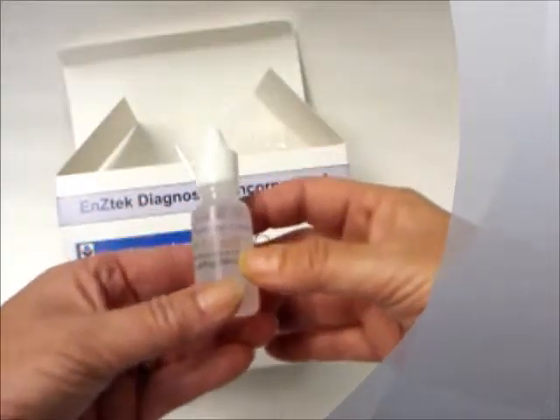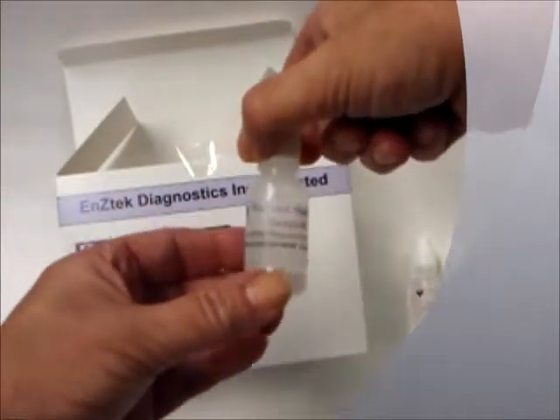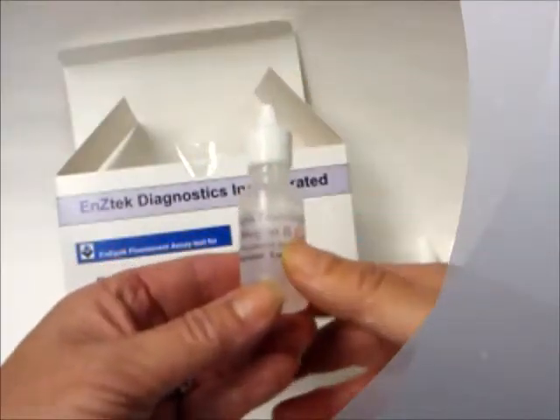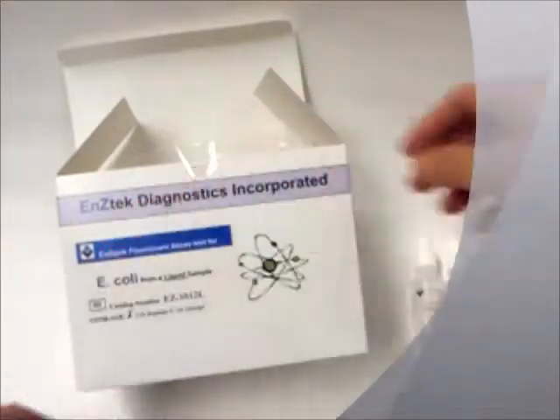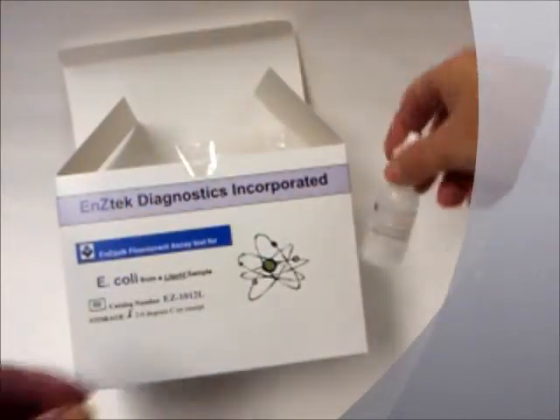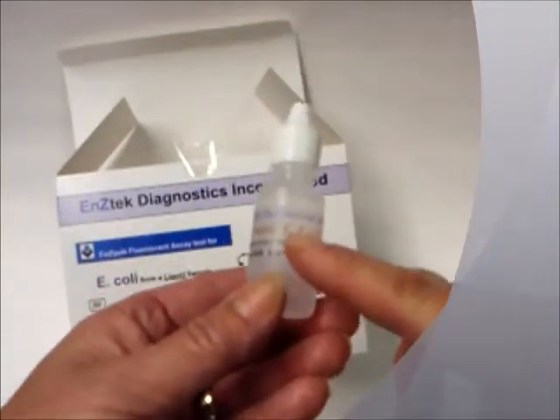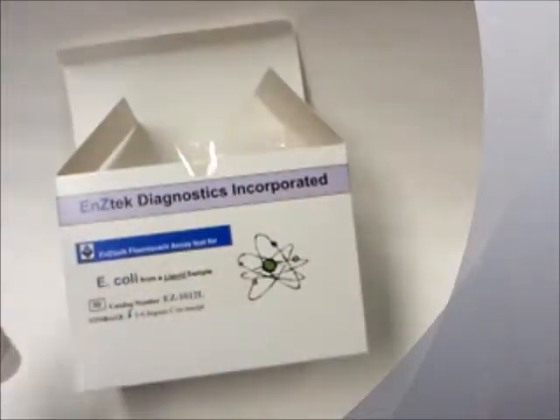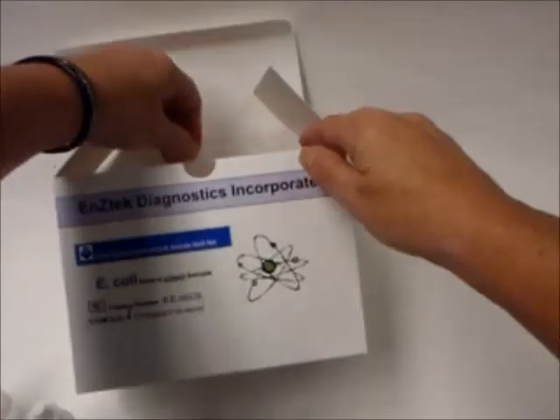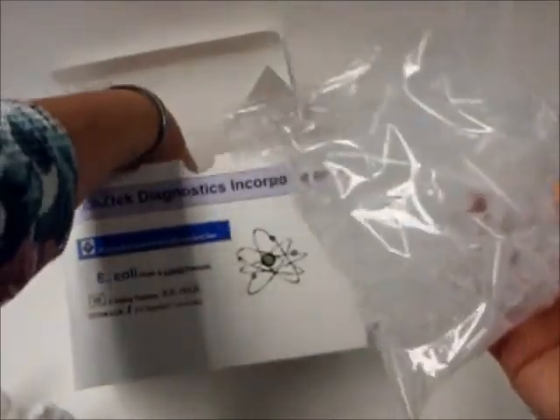There is a bottle of Reagent B, which is an enzyme inducer and helps trick the bacterial cell into producing more enzymes. Not all kits contain Reagent B. There is one bottle of Reagent C, which is a lysing agent. Some bacteria have enzymes which are intracellular; therefore, a lysing agent is used to rupture the bacterial wall and release the enzyme. The kit also contains plastic mixing vials and small glass testing tubes.